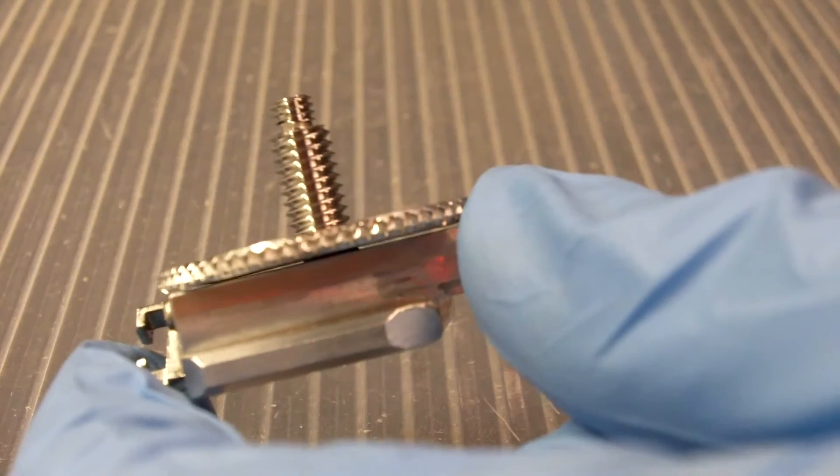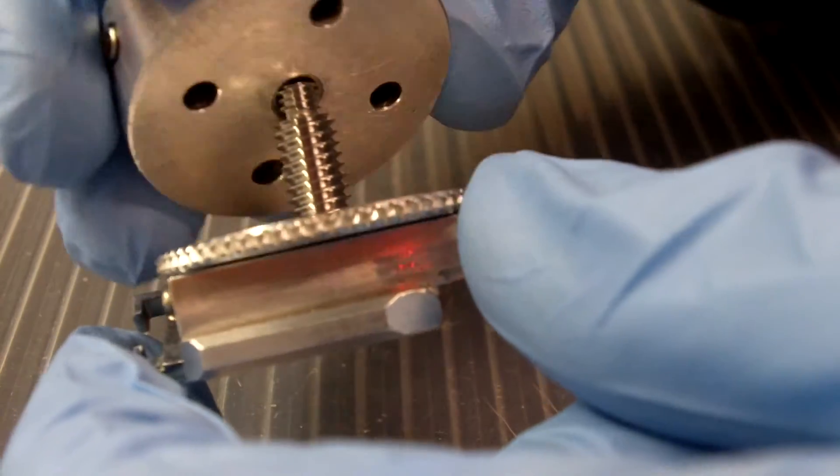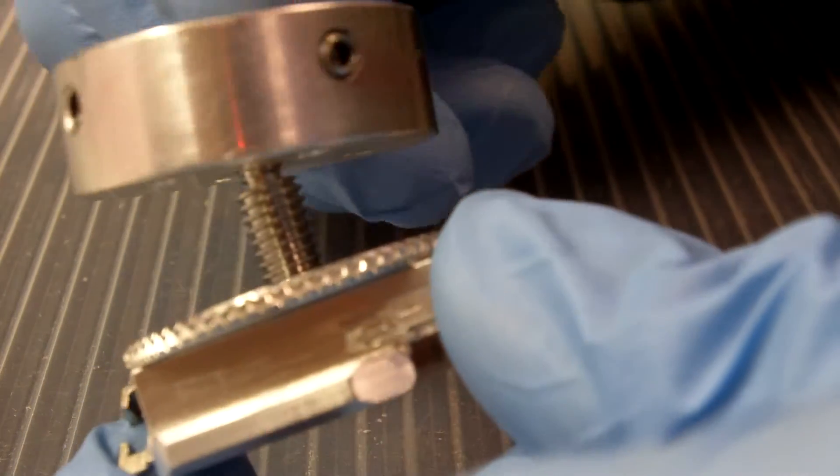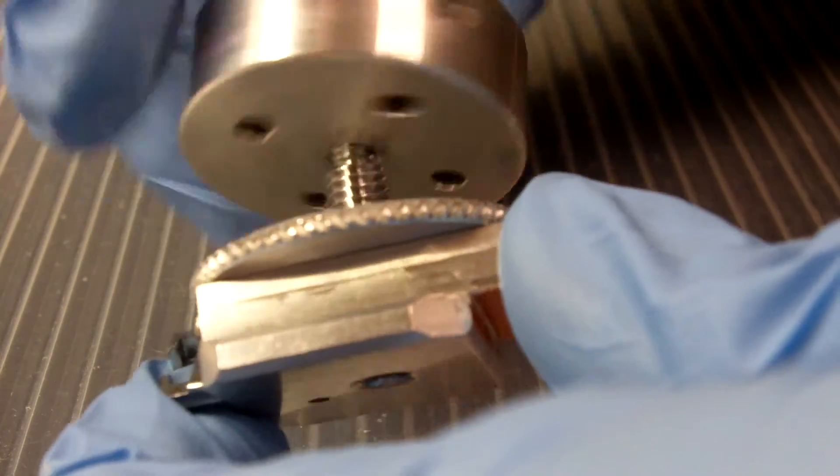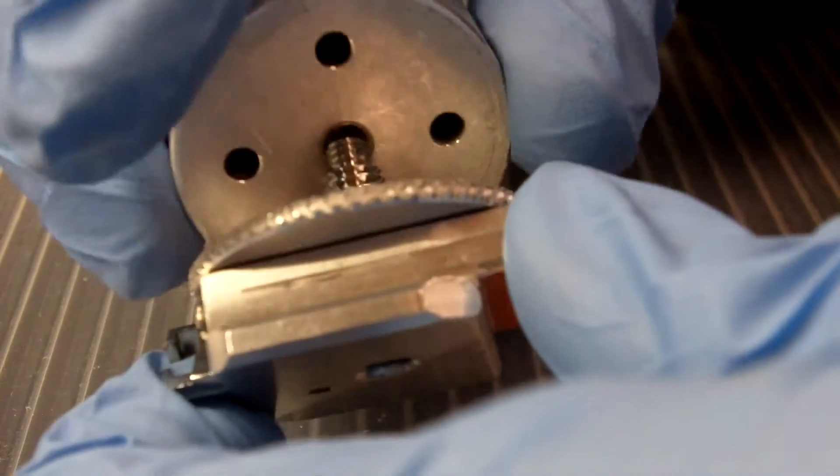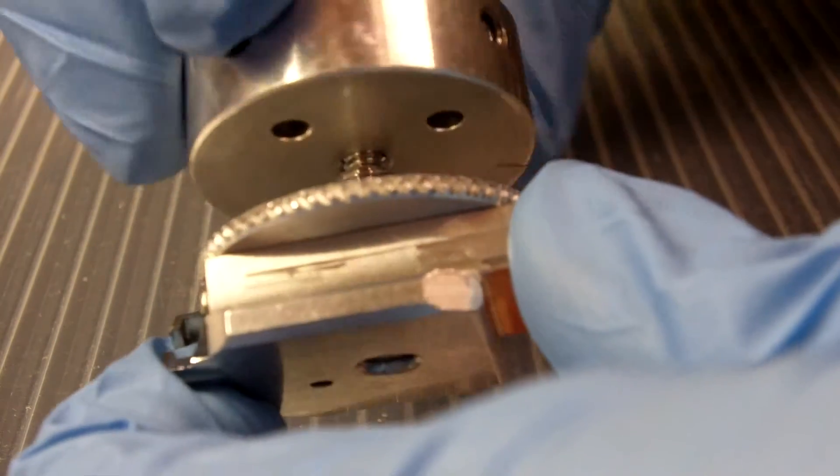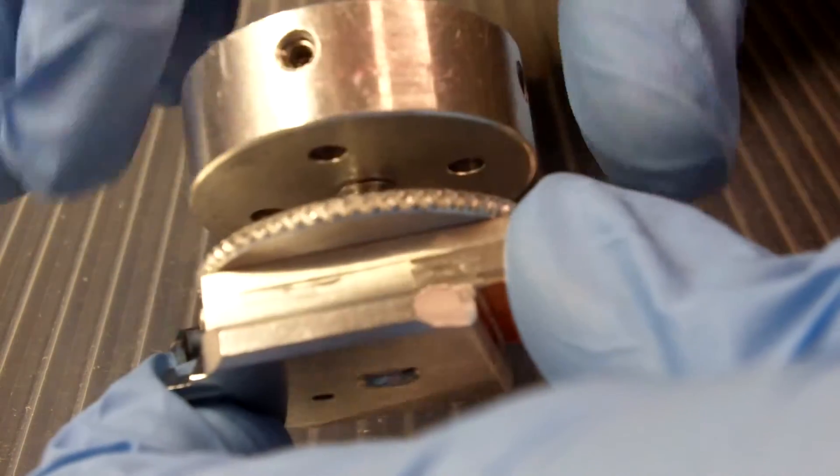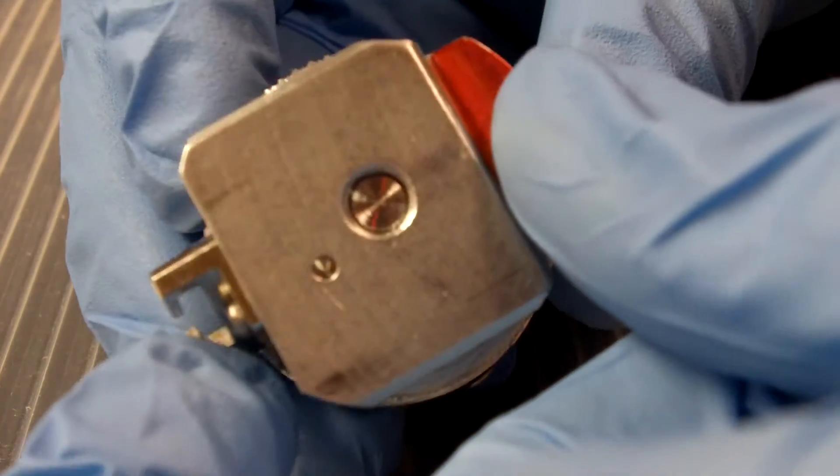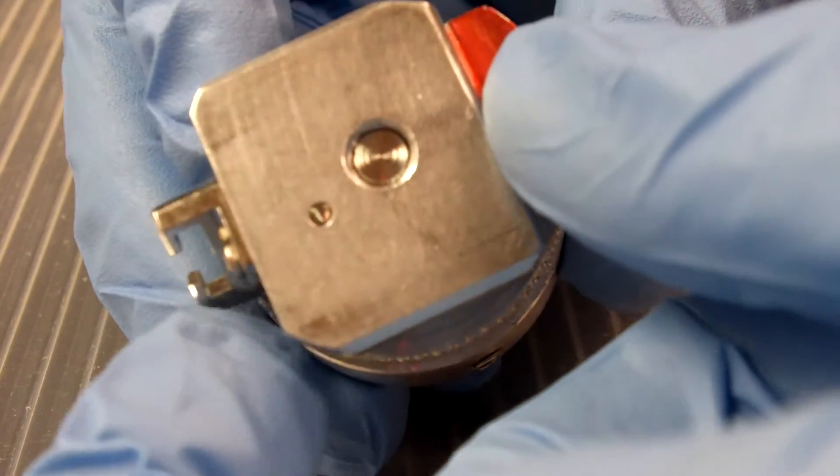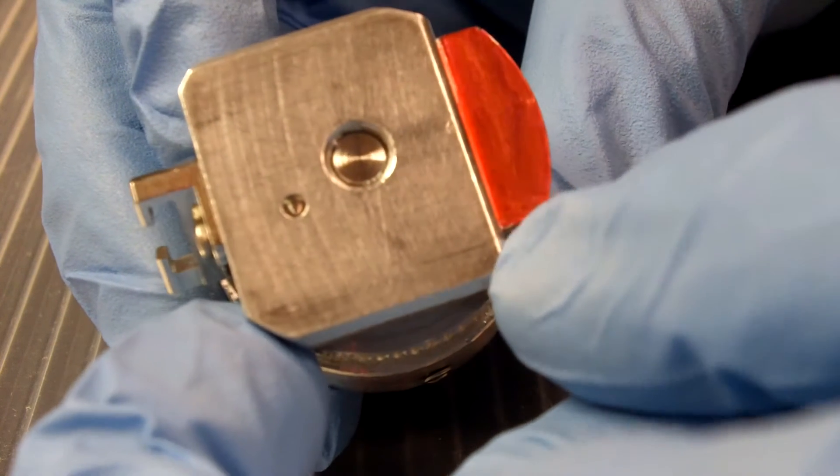So if the screw can still move around, what is going to happen when I start to screw the platform on the top here? Well, all it's going to do is just screw that screw in all the way to the bottom of the base, which is exactly where we don't want it to be. And man, that is really, really going to get that stuck in there. Bad.